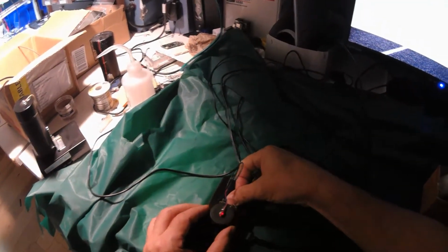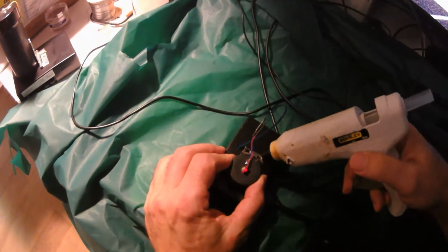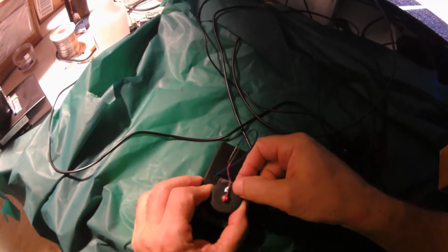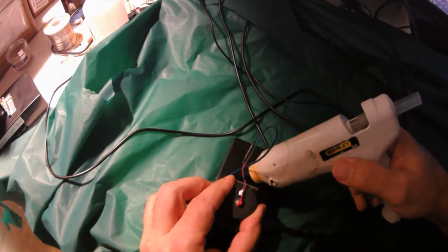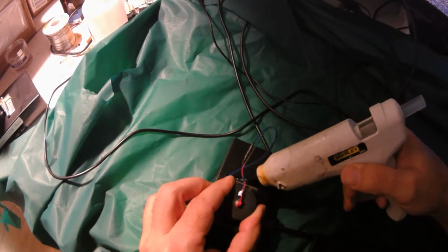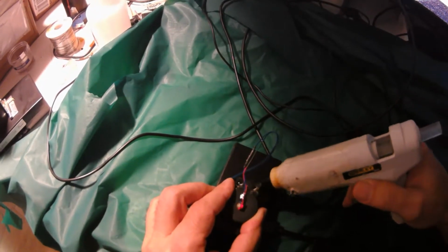And so I'm just holding it down with my thumb. So this is lifting and dropping. That looks pretty good. Okay, so I'm going to hold it steady, take my trusty hot glue gun, and actually what I'm going to do, I'm going to lift the hinge. Okay, let me see. I'm going to lift it, align it again. I'm going to put hot glue underneath, because if I tacked it down without putting it underneath, I'd never get glue underneath. Now I'm going to drop it.